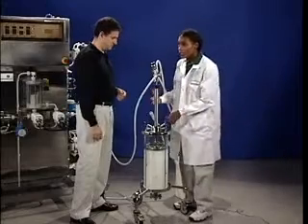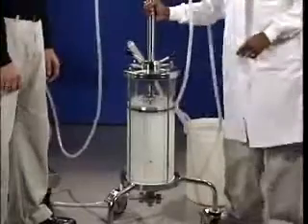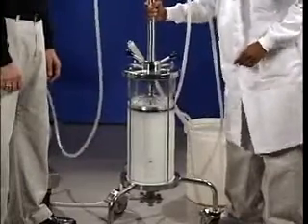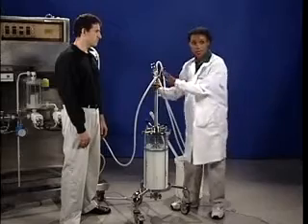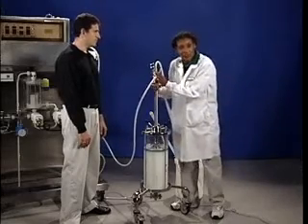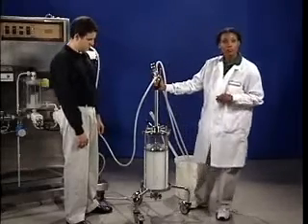Is the top valve in the right position? Yes. Now we'll lower the adapter until the slurry passes just above the O-ring. We're shaking things to dislodge air bubbles under the adapter. Air is the enemy inside the column because an air bubble disrupts the flow profile in that region. I'm also lowering the adapter a bit just to purge any air underneath it. Now I'll tighten the O-ring and make sure the top valve is open so that the packing buffer will exit through the adapter rather than around it. Then we'll start the pump and purge the hoses from the pump to the top of the column.